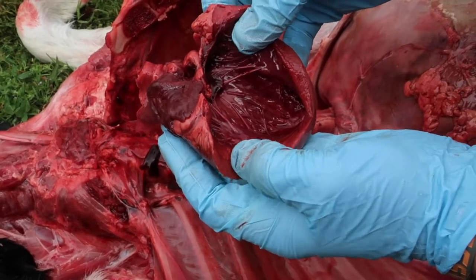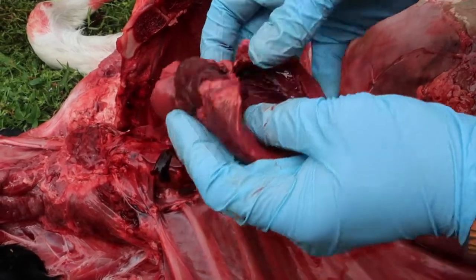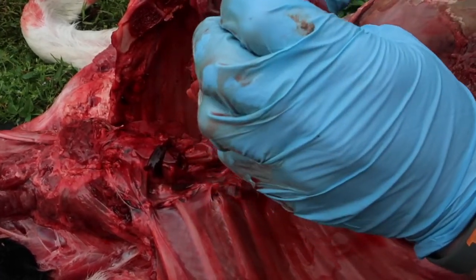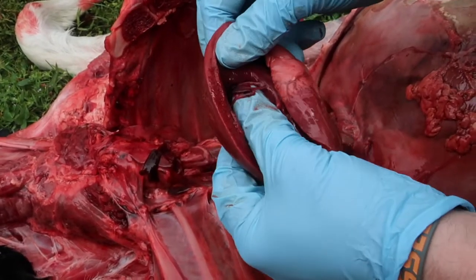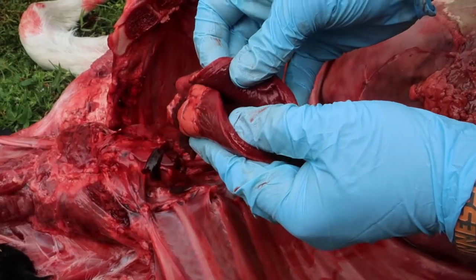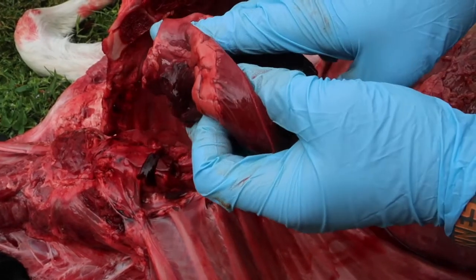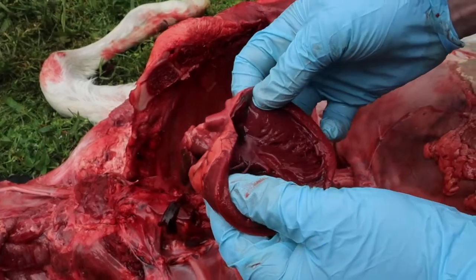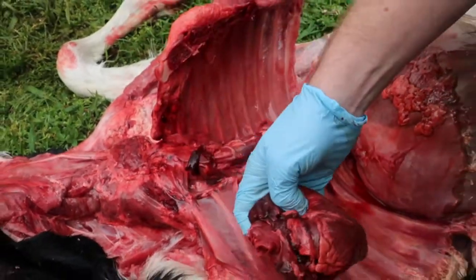And once that blood is reoxygenated, it's then going to enter into the left side of the heart, into the left atrium. I'm coming over here to this side now. It's going to enter into this left atrium here, and it's going to flow from the left atrium into the left ventricle through the AV valve on that side. And that left side of the heart, the very strong side of the heart, will then contract and press blood out through the aorta, going back into the tissues, oxygenated blood going back to the tissues to supply them with oxygen.